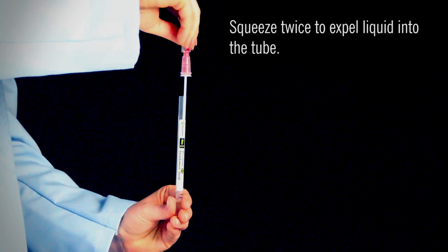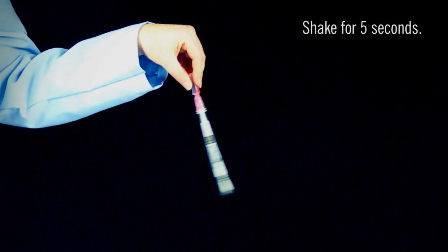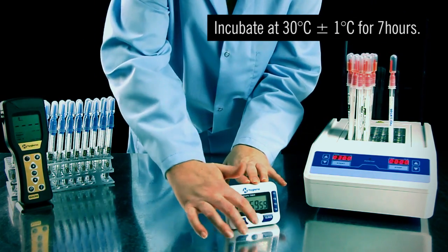A small amount of enrichment media will stay in the bulb. This is okay. Replace the swab in the tube and shake for 5 seconds. Incubate the enrichment device at 30 degrees Celsius for 7 hours.